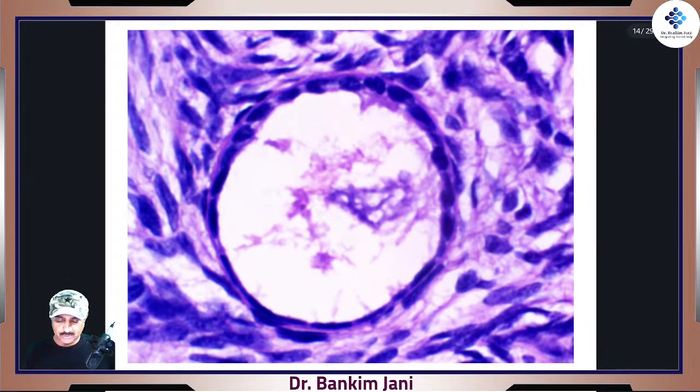Beyond doubt, once you see it, you will never forget for the rest of your life that it is a very classical simple cuboidal, right? Simple cuboidal. Now you might say that some of the cells are looking a bit flat. Well, it happens. It happens because this is a very fast growing, right? So this is like a simple cuboidal, but most of the cells you will find that they are big one, right? Very big.